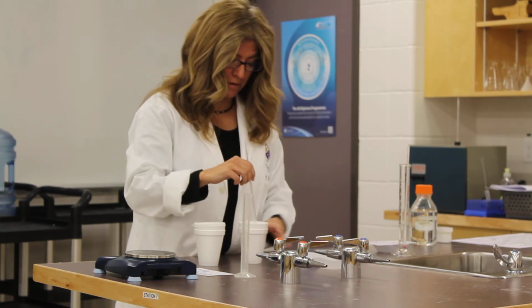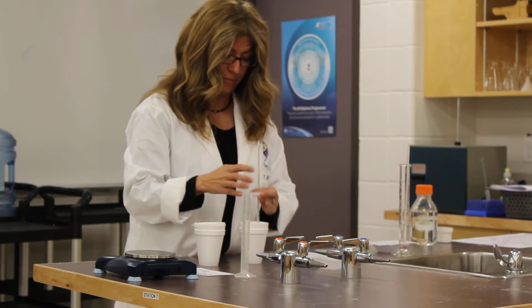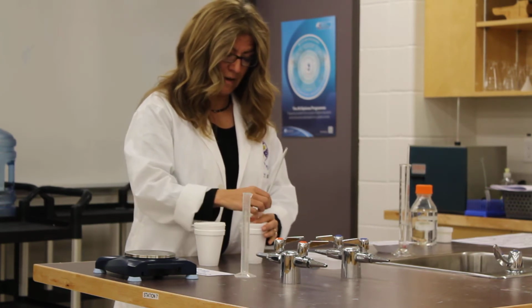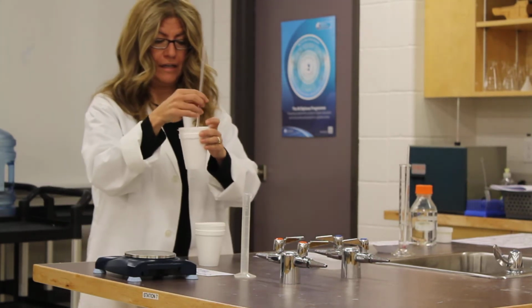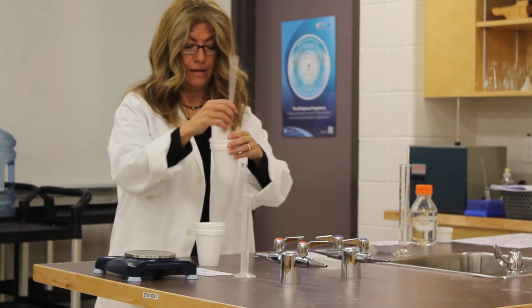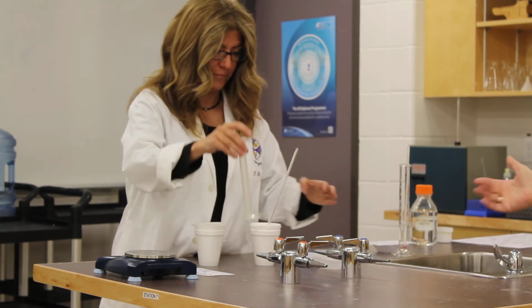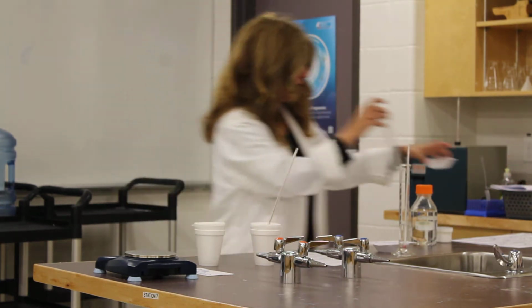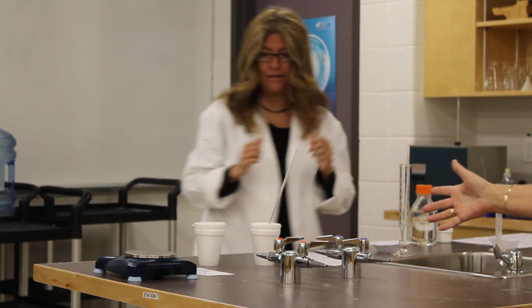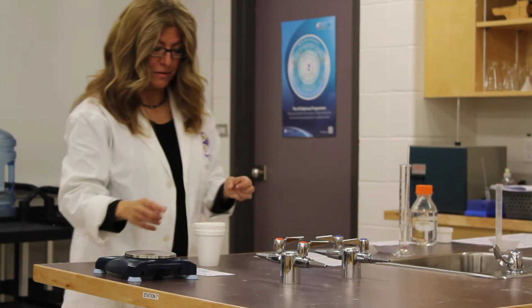And we're going to stir. Oops, we're going to put the lid on really quick, because now it's an insulated system, right? Perfection. Fancy calorimeter, insulated system. And we're going to let that do its magic. I'll stir it. You can stir it if you like. Then you can do the other one. Okay, and then we're going to have a stir. Off-screen stir.